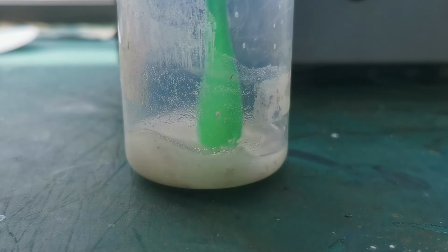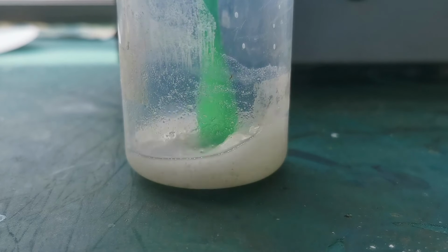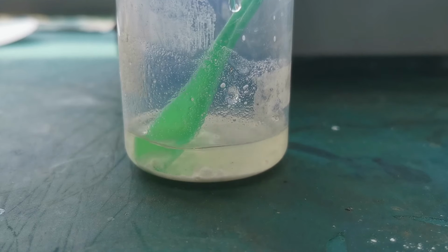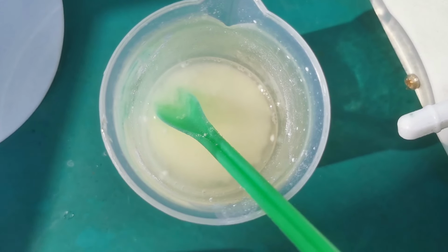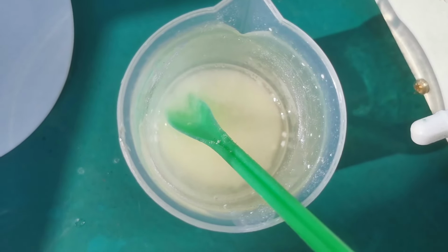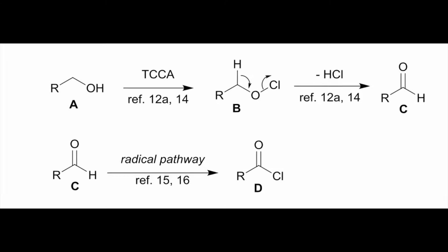Anyways, I started adding some benzyl alcohol dropwise to the TCCA solution, and apparently nothing happened. I then added the entire pipette of benzyl alcohol into the beaker. After 5 minutes, the mixture started releasing some bubbles. It wasn't very fast, but at least it shows something is happening. In theory, the TCCA is supposed to oxidize the benzyl alcohol to benzaldehyde and then to benzoyl chloride in 2 stages, which release hydrogen chloride gas as a byproduct.